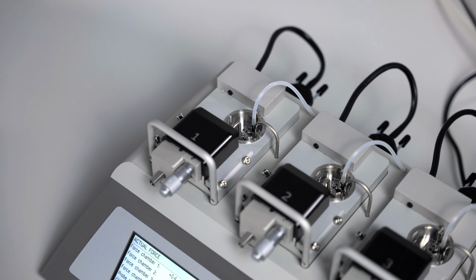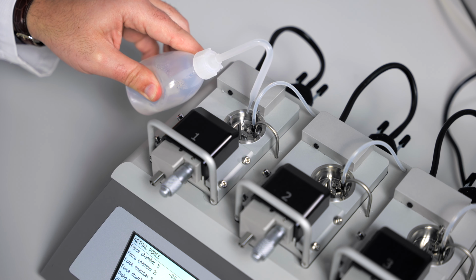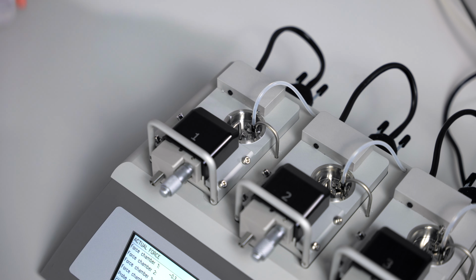Fill the chamber to the edge with 8% acetic acid. Allow that to bubble for 1 minute. While this is bubbling, you can use a cotton swab to clean all the chamber surfaces. Be careful not to hit the transducer side mount.